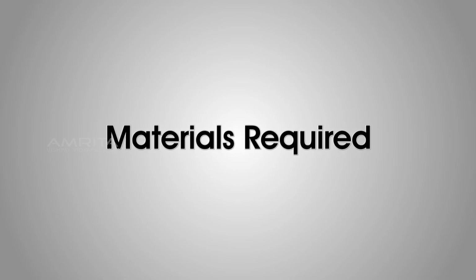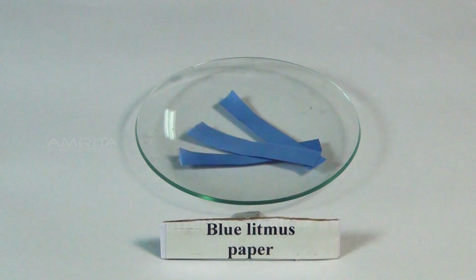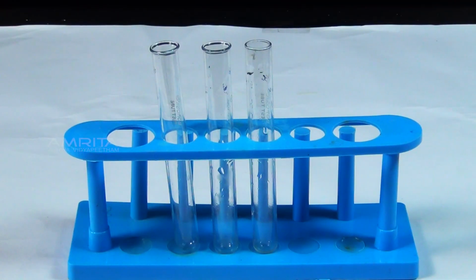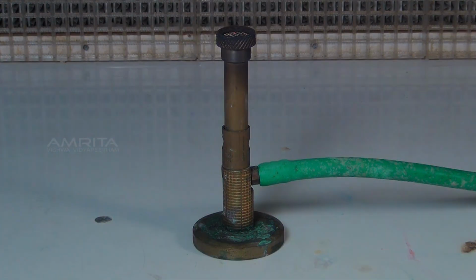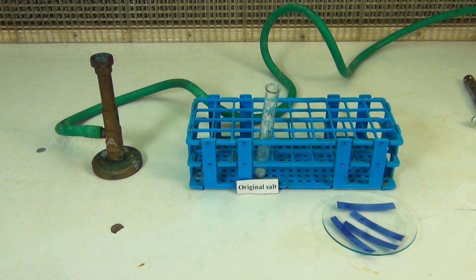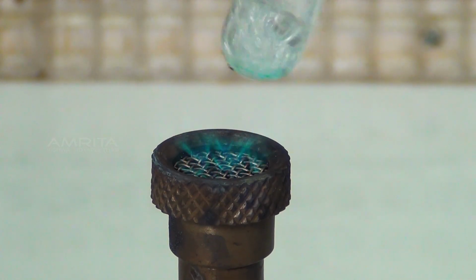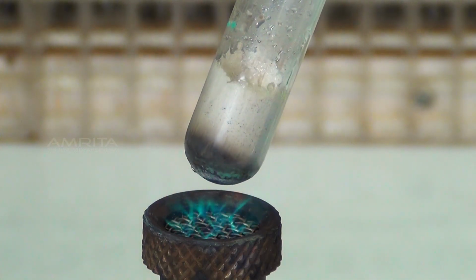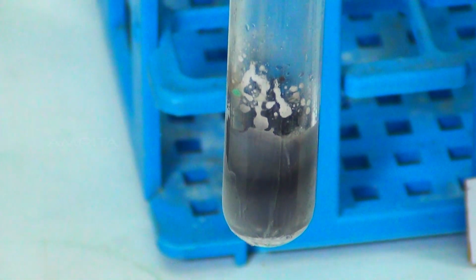Materials required: original salt, blue litmus paper, test tube holder and Bunsen burner. Procedure: take a small quantity of the salt in the test tube and heat it over the Bunsen burner. On heating, acetate undergoes decomposition to evolve vapors of acetic acid.